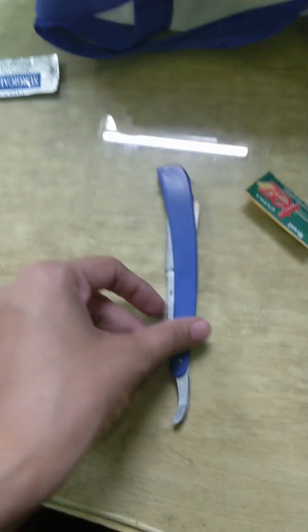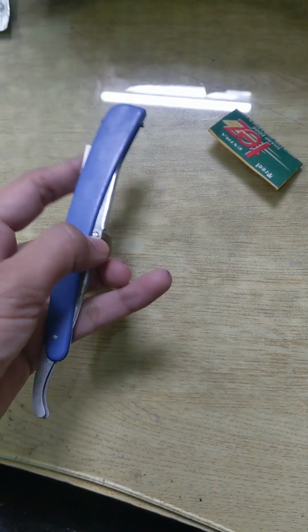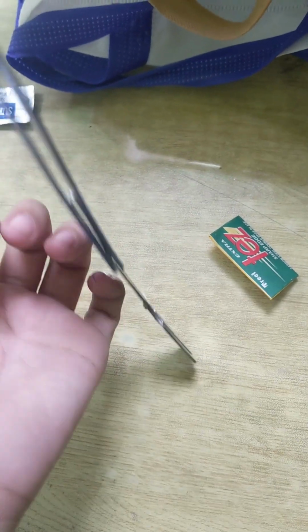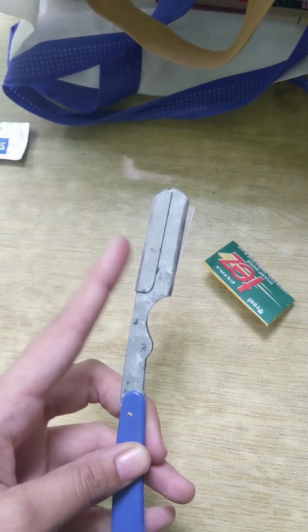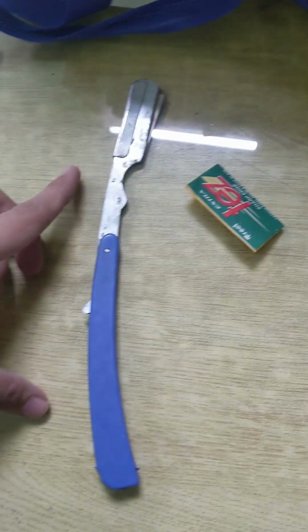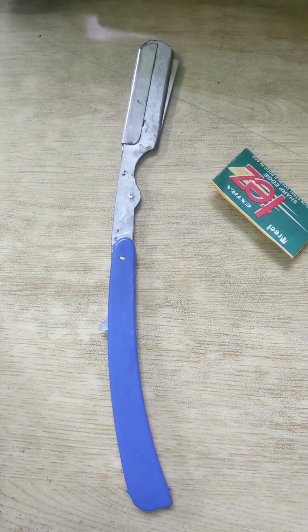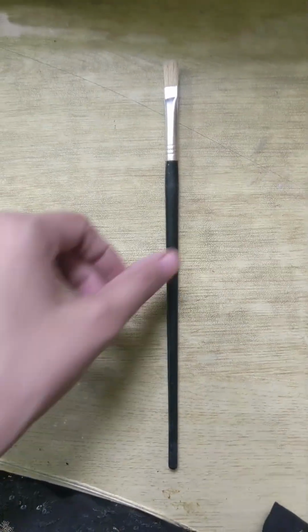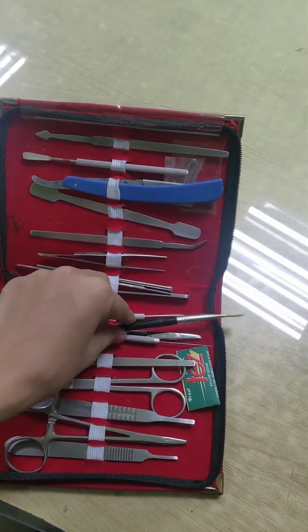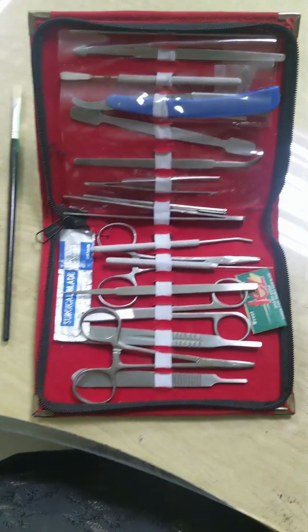And the next one is the very commonly used dissecting razor. It's usually flat, and is used to slice very thin, uniform sections of tissue while making a microscopic slide for your microscopic examination. When you want to make a slide for the microscope, you will use this to cut a very thin layer of tissue, and then you will make a slide using that tissue to examine. And the next is the brush in a dissecting kit. It is used for cleaning delicate specimens, gently sweeping away any debris, and untangling blood vessels, etc.